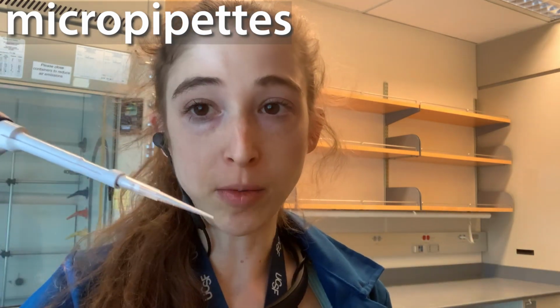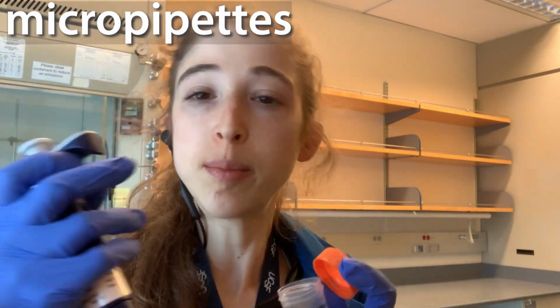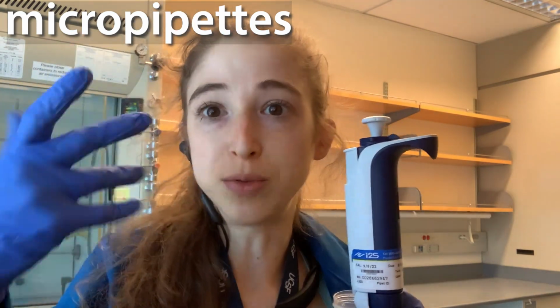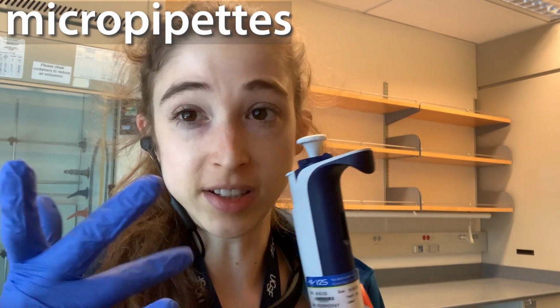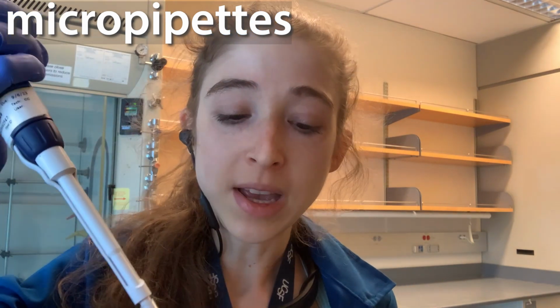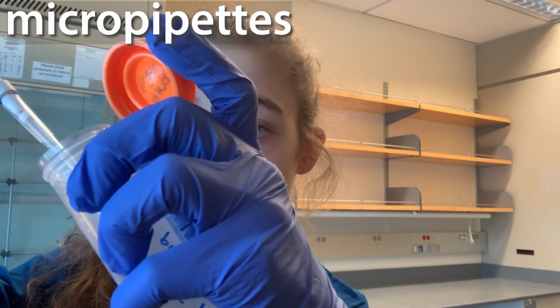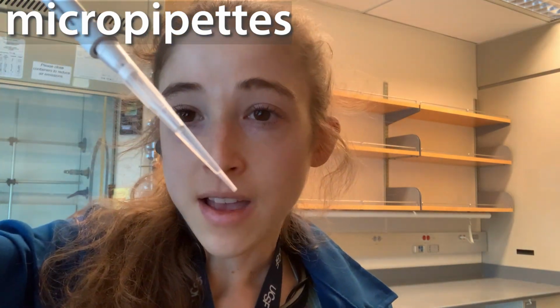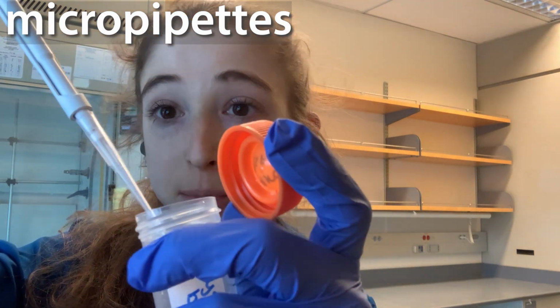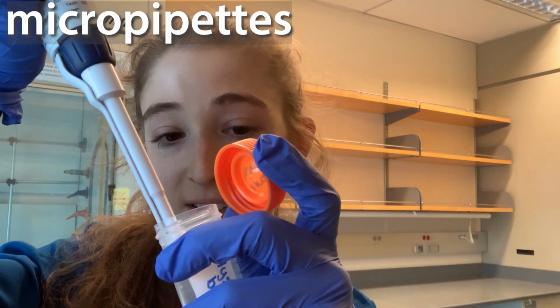So say you're using a micropipette and you have some sample and you want to suck all of it up, and this is a bad example because I have way too much liquid in here. You can set your pipette to a larger volume than you would actually need to pipette it up, but you don't want to just go in and suck it all up. Instead, what you want to do is go till you're right at the bottom, just have a little bit of air, something like that. And if you don't pull all the way up, then you're going to introduce the chance of having bubbles form.